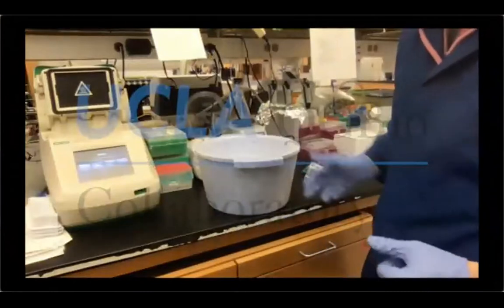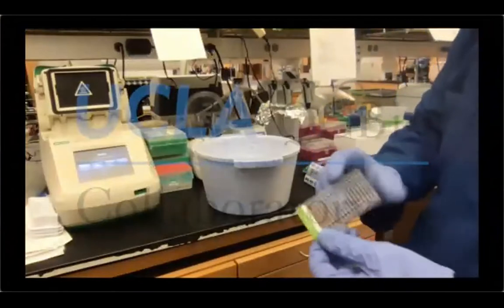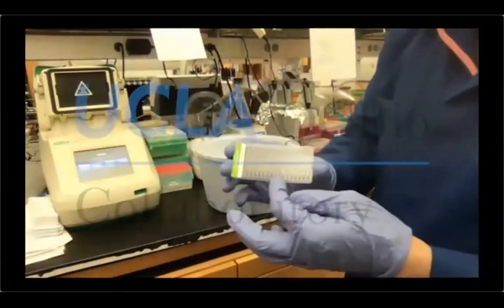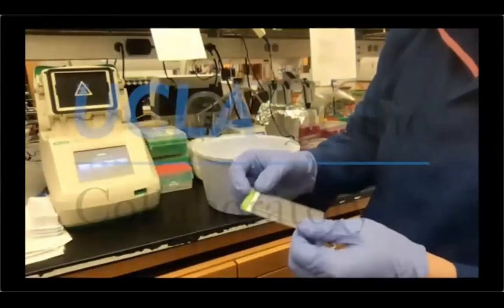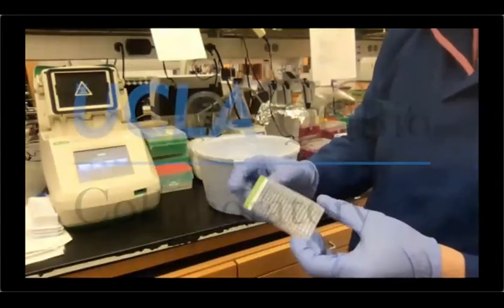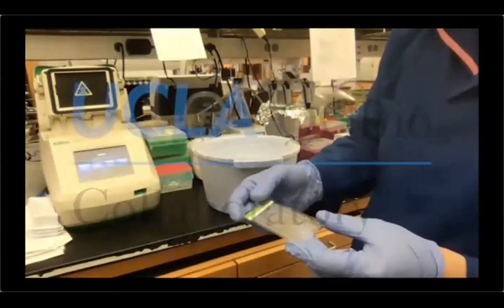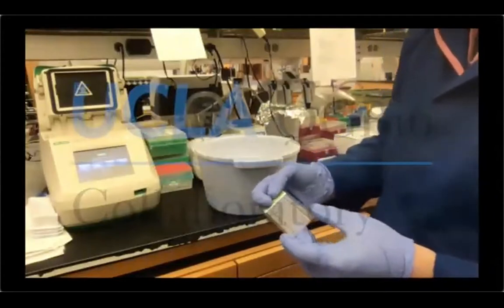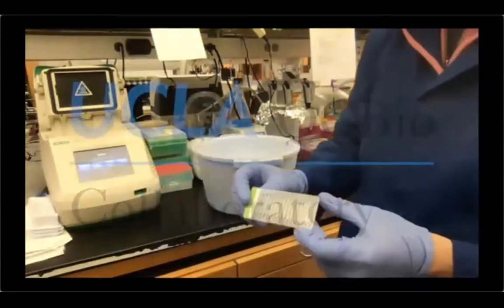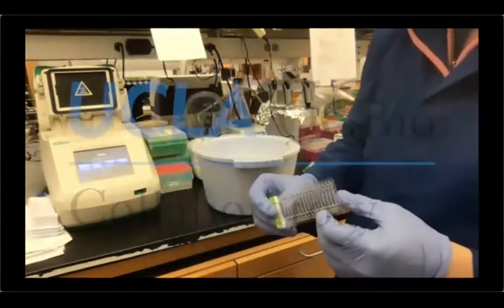And while we are waiting, we can talk about the screen tapes, okay? So the screen tape is actually made of 16 little separate electrophoresis chambers. You can run as many as you want, up to 16, of course. However, if you are not running 16, like for example, I'm doing today, I'm just gonna run 5 plus 1, so 6. Remember, always an even number of samples. You can reuse the screen tape for the unused lanes, okay?